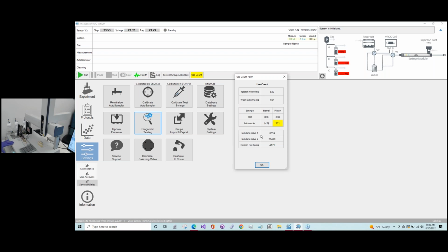So it's important to have the annual preventive maintenance visit so that these things can be taken care of before they actually do fail. And in terms of the injection port spring, this again is something that you will need a field service representative to come on site and help you with, because it's going to be removing the housing of the unit and dismantling this injection port cover. So that's probably beyond what you'd want to do on your own.